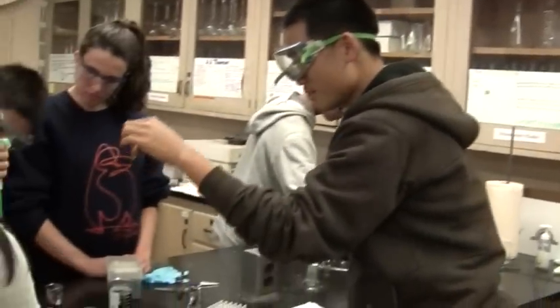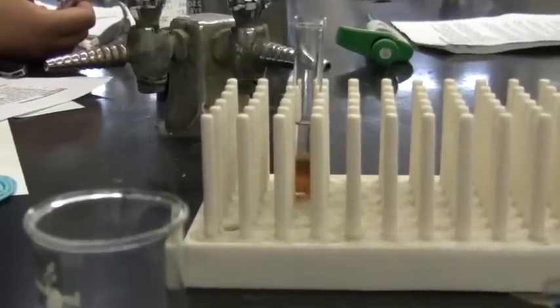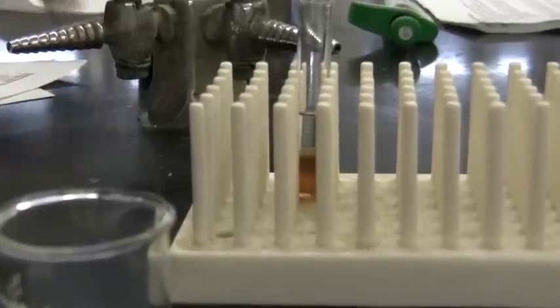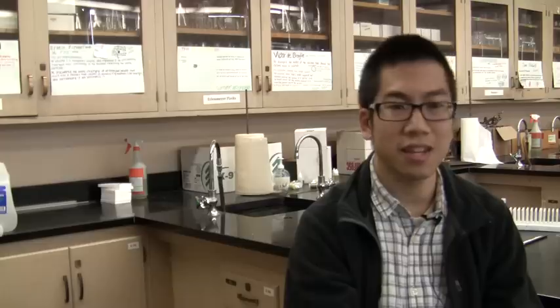They'll take the isopropanol out — which will contain the caffeine — and put it into a small micro vial. Those micro vials we will ship off to UC Berkeley, where the MassSpec facility will analyze them and send us the results. Then my students can do the calculations to find out the actual caffeine content in their soft drink.